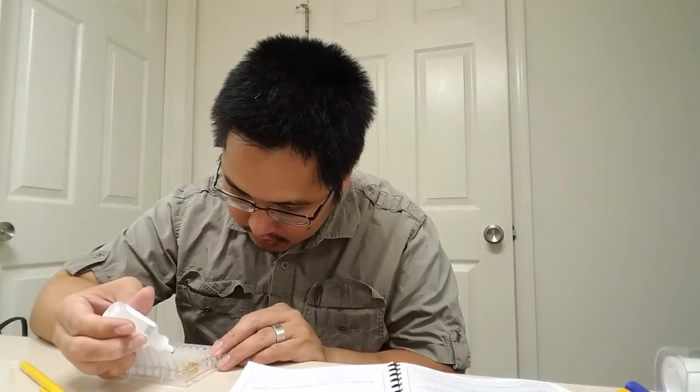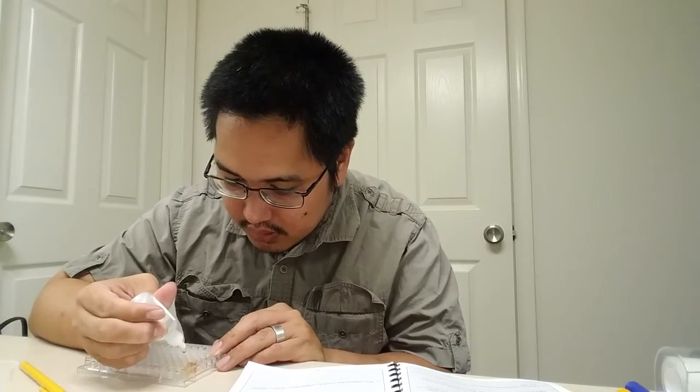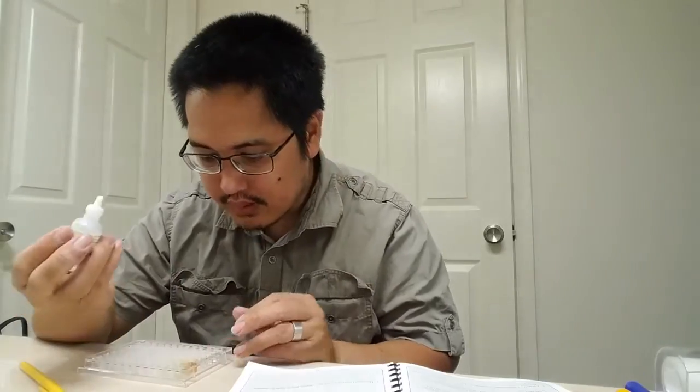All right, the next one is potassium hydroxide. So we're going to put that in column number 2, 3 drops each. I'm going to start with A2. 1, 2, 3. 1, 2, 3. 1, 2, 3. 1, 2, 3. You get good at dropping these things inside.